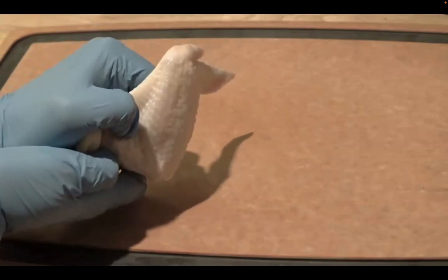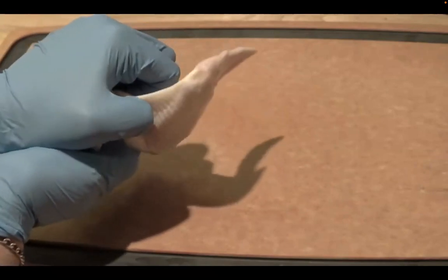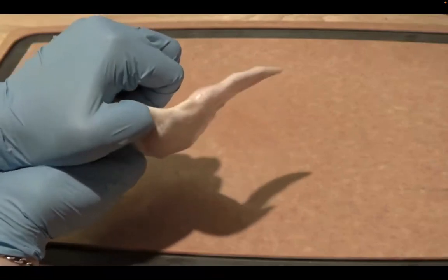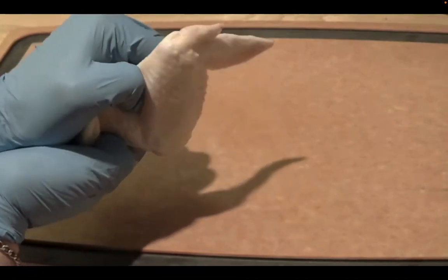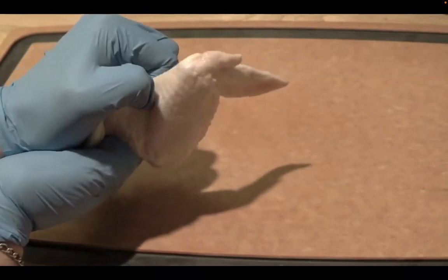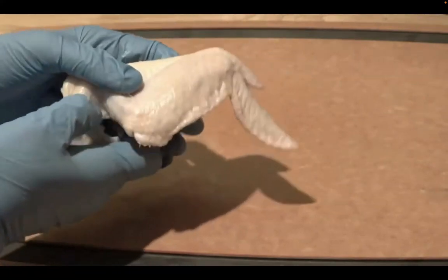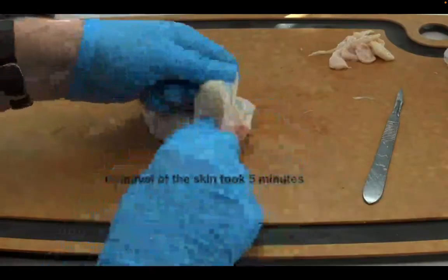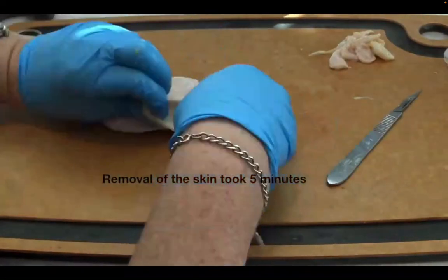And you can tell it's still moving, but not like it did in the last lesson, where you can almost see like the chicken pointing to something. So there's definitely some difference here, but right now the skin's on it, so it's hard to tell. So you can notice that the wing is not moving like it normally did. So next thing you're going to do is take off the skin, like we did last time, so we can kind of see what's happening underneath. So the video is just showing how that's happening here.